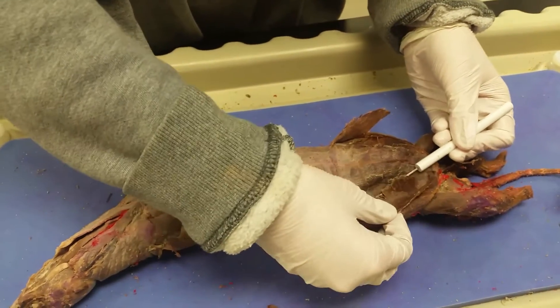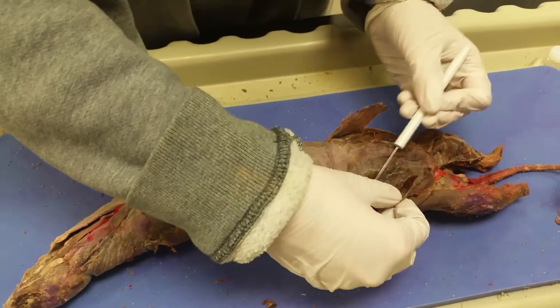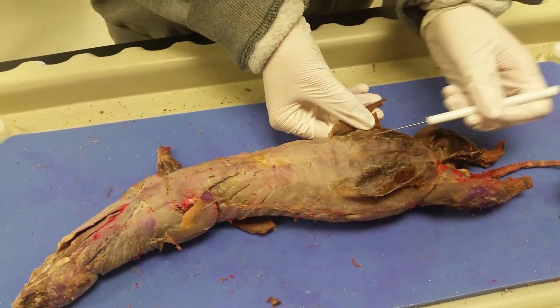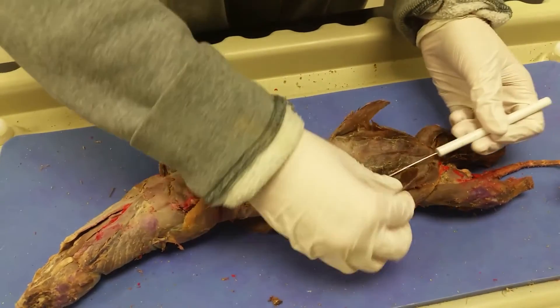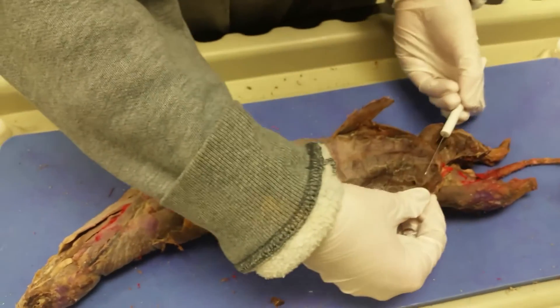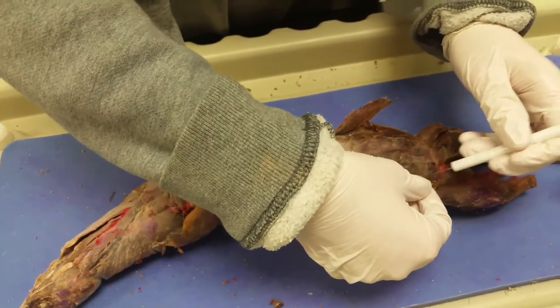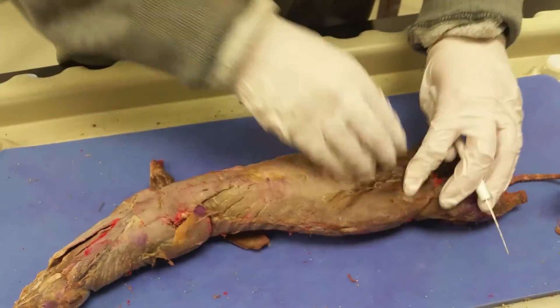Underneath the internal oblique is the transversus abdominis, right here on this side. Then, if you accidentally go too far, you can see that this is the peritoneum right here. And then on the inside, that's the internal organs of the mink.